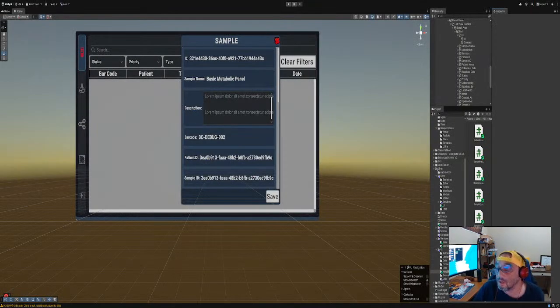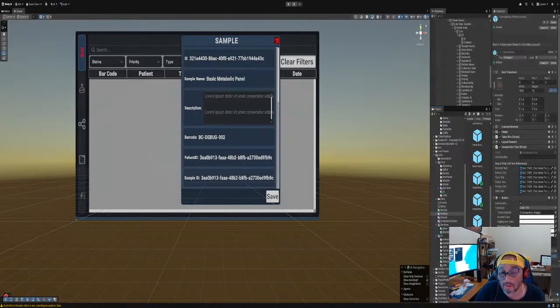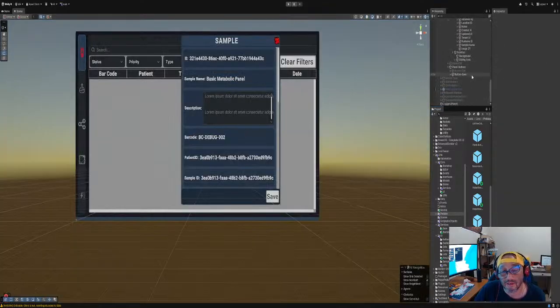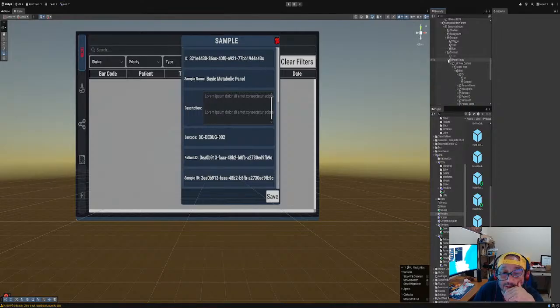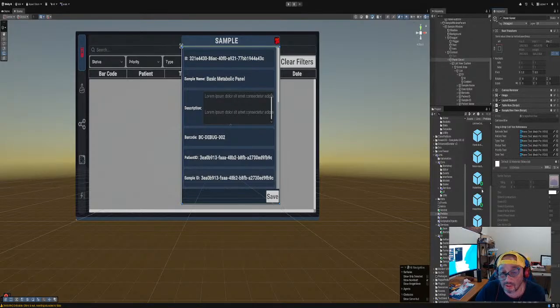So okay, let's go to the prefab. I deleted that. Let's go to the prefabs. Here we go. All right, so he wants us to use this drag and drop cell ref, this sample row view. We have to rename it something else, but we'll do that for right now. Panel save, and then we're gonna do sample row view. I think it might work. We are saying that's what the sample is, right?